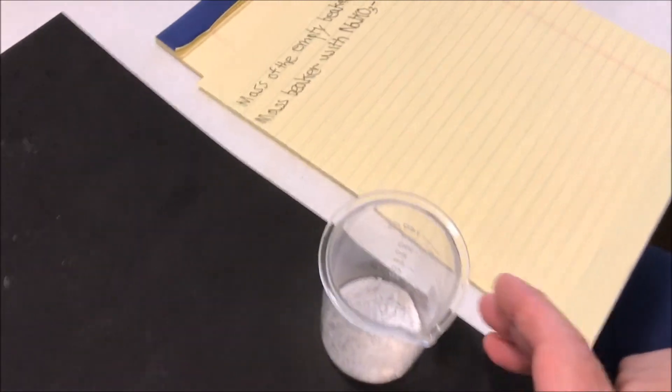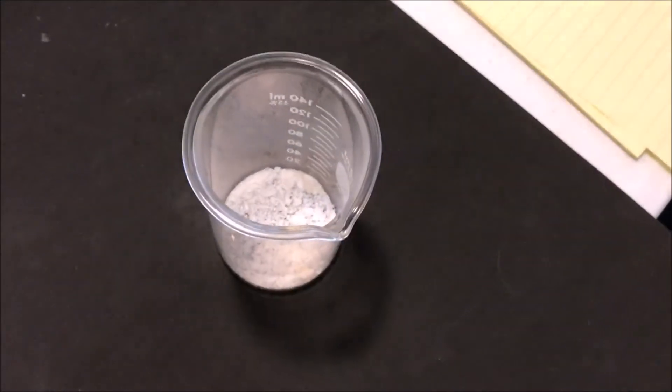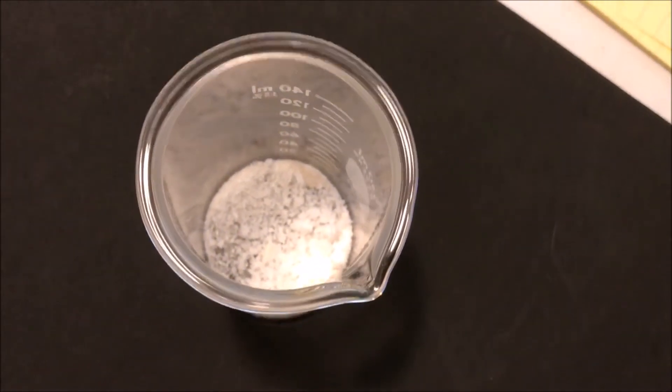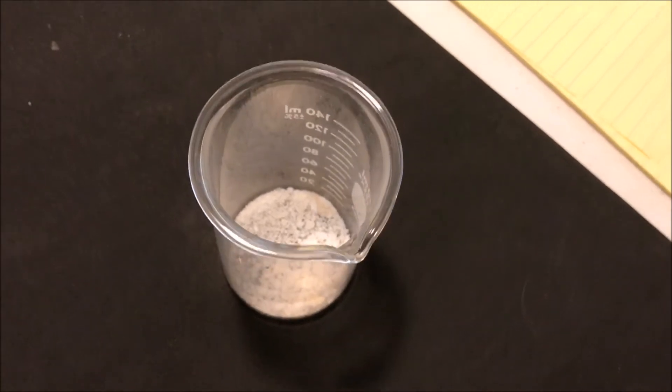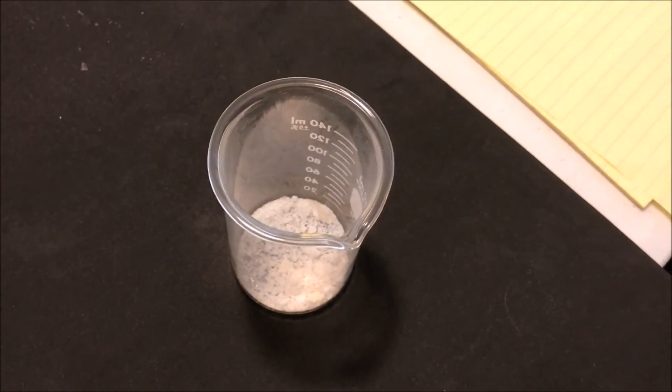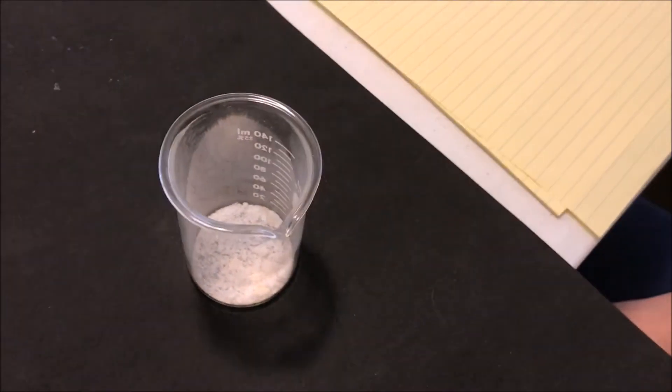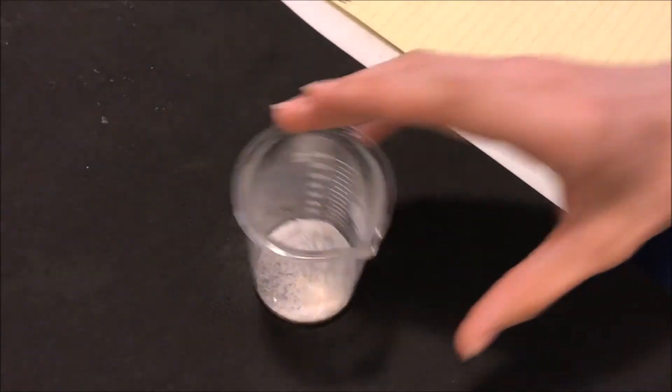We've heated up the product of the reaction, and you can see the sodium chloride that we've collected. It's been heated for a very long time, and we think it's come to constant weight. All right, so what should we do now? Shall we weigh it?